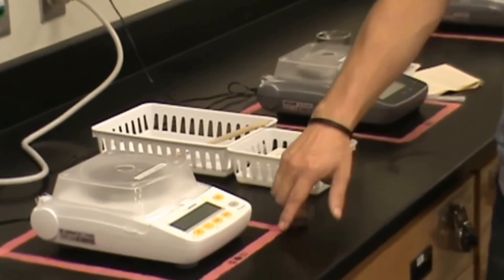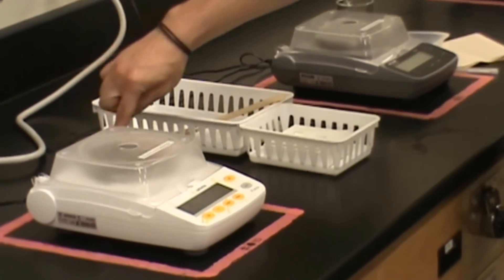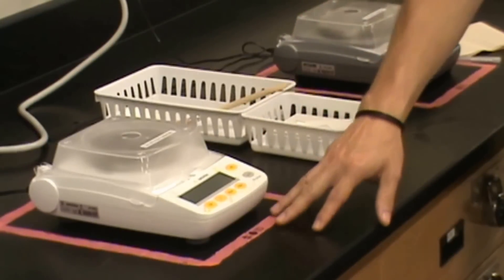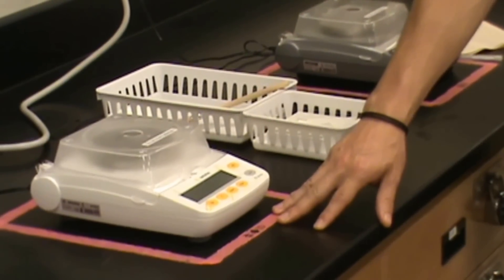The first thing you'll notice about the lab balance is this is in a designated zone. You don't want to move it outside of this zone because it's been leveled to ensure proper operation.